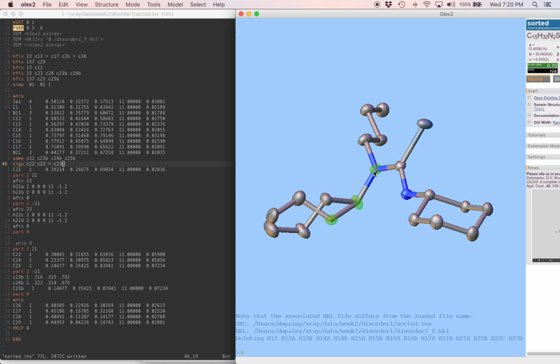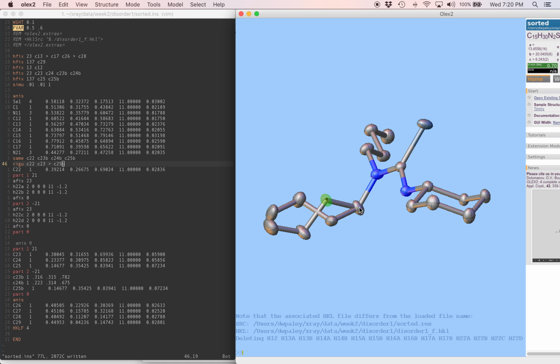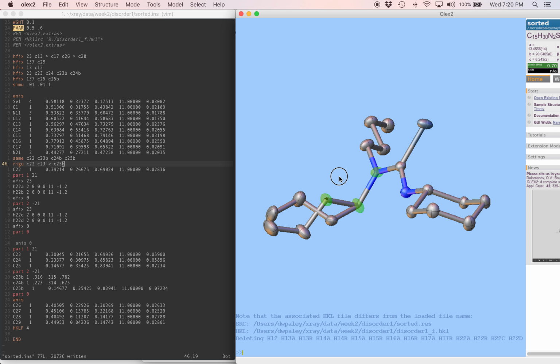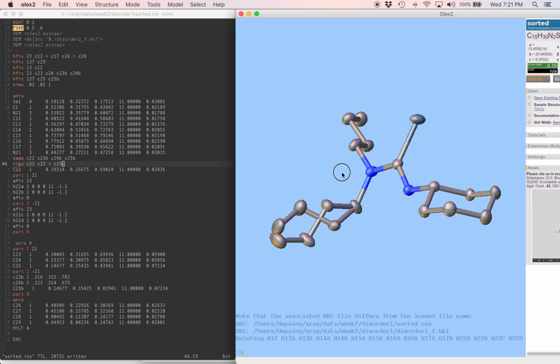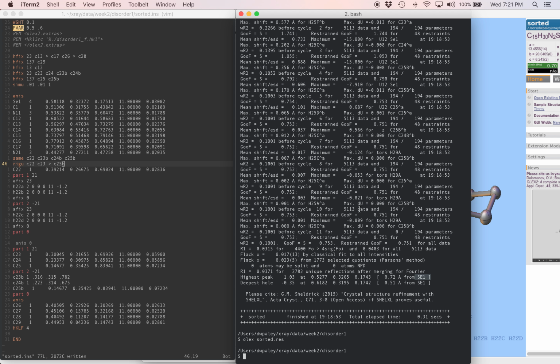I think maybe I see something else funny here. This is a 130 degree carbon-carbon nitrogen bond. It should be 109 degrees, so 130 really is pretty unusual. And this one is 104. Again, a bit weird. The combination of those two things is making me think maybe, as a matter of fact, we should split carbon-22 in two parts. That's going to be easy to do. We just have to make sure that we fix up our restraints appropriately after we do that.